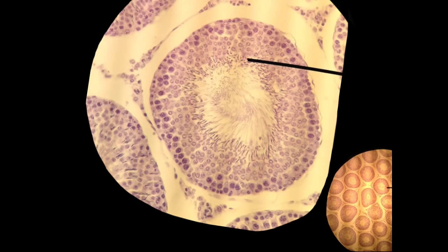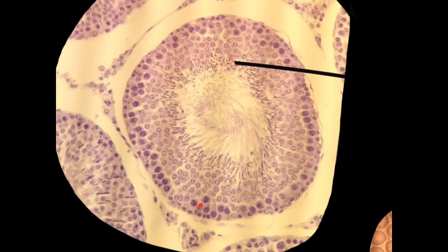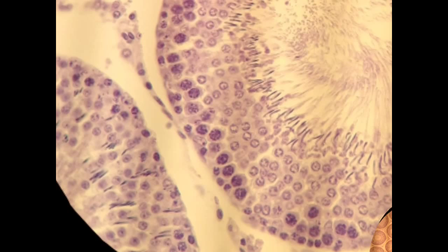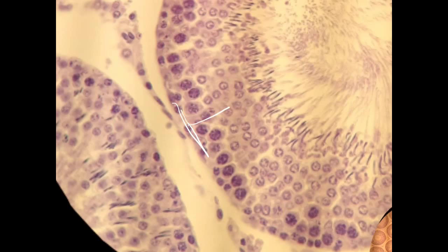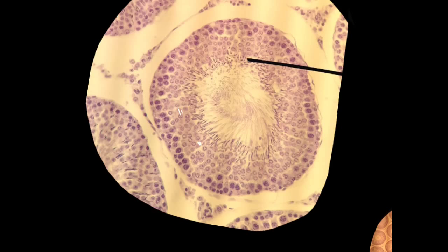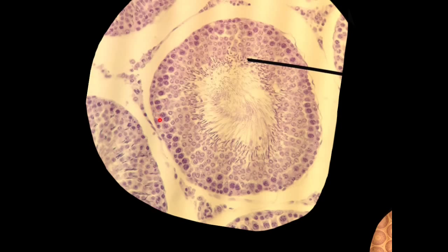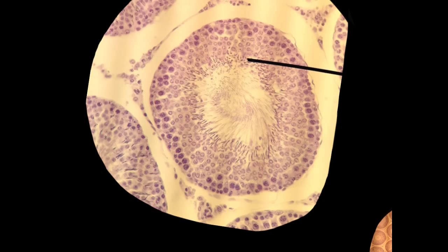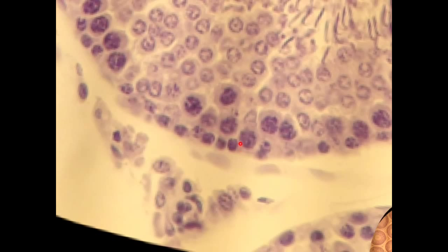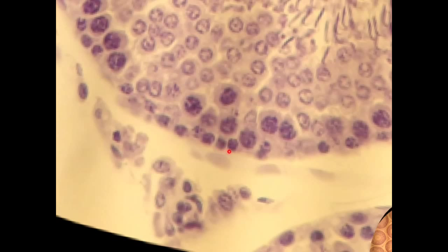As we get closer, we see that same pattern with the dark ones on the outside, and we can start to differentiate between the dark cells. Working from the outside and going in, the first cells right on the very outside still have a dark nucleus — those are the spermatogonia. There's a cluster of three right down here on the outside with no more cells beyond them. Those are the spermatogonia, and that's the beginning of the process of spermatogenesis.